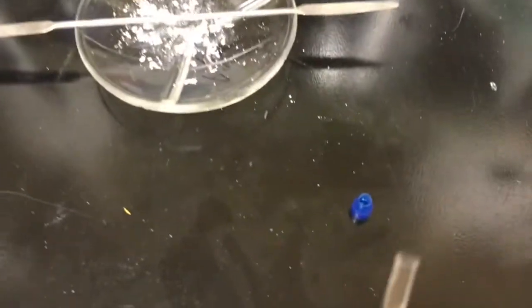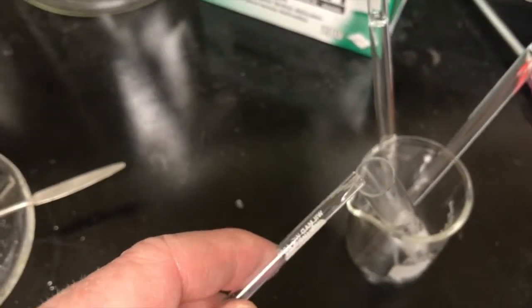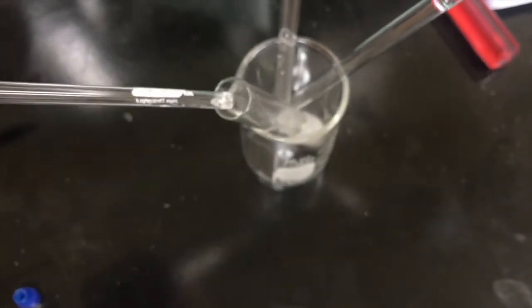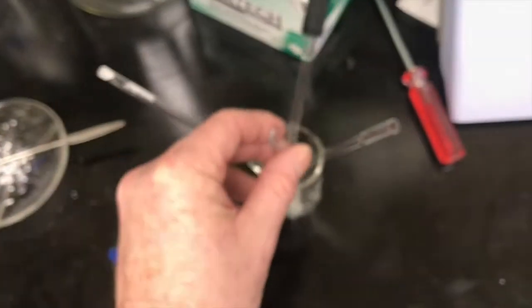I removed the cap from my NMR tube, and I'm going to pour this NMR tube into the test tube that I was evaporating from just now. So now I've got basically almost all of my sample back in here. I'm going to still use this same test tube, so I don't mind having a little residual in there. And I will take this over to the nitrogen tank again and evaporate some more.